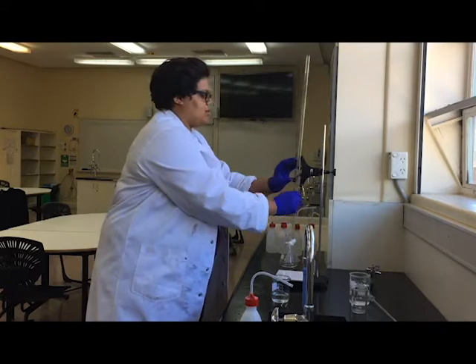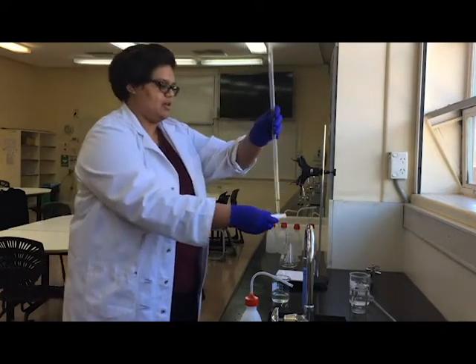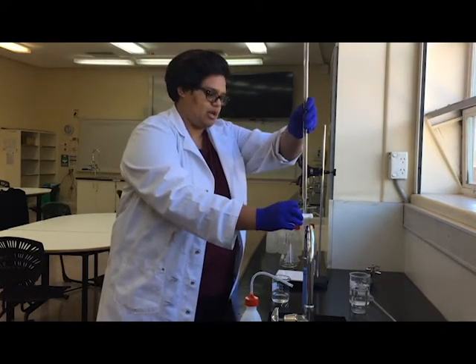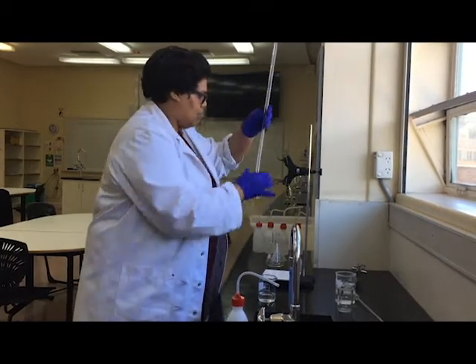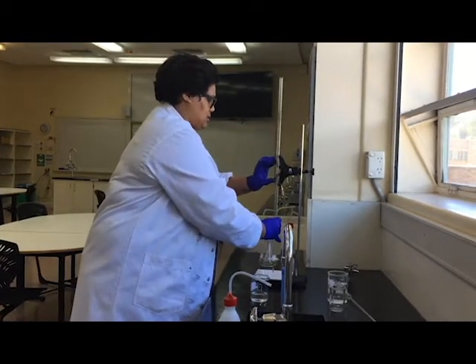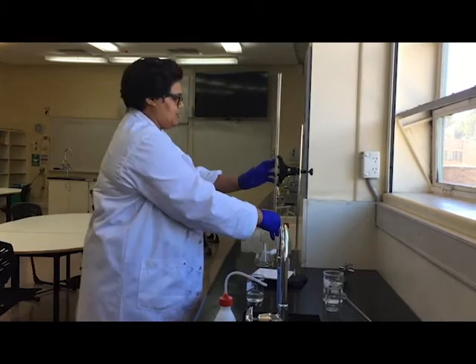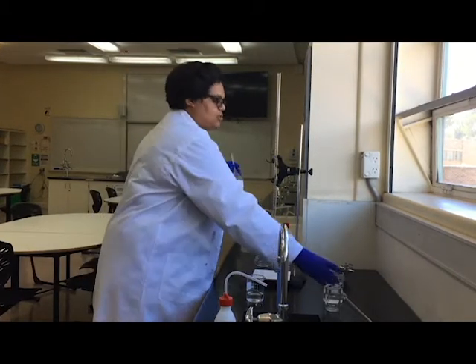I'm going to do the same thing with our burette. I'm just going to make sure there's nothing left inside the little end bit. I'm going to shut it again, and in order to fill up some into the burette, I'm going to use a funnel. I'm not trying to just pour it directly in.